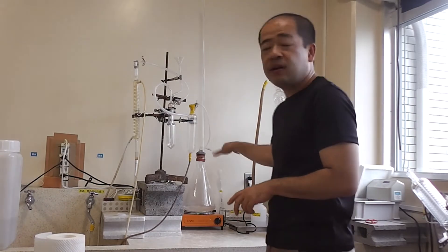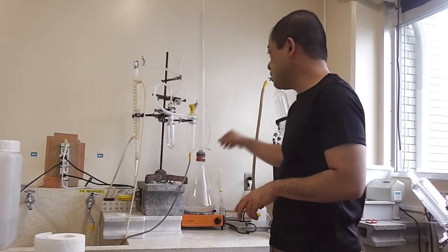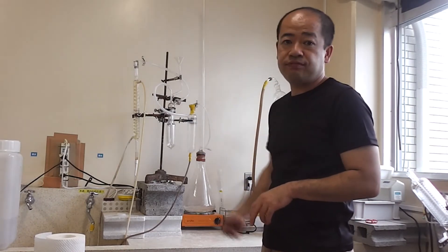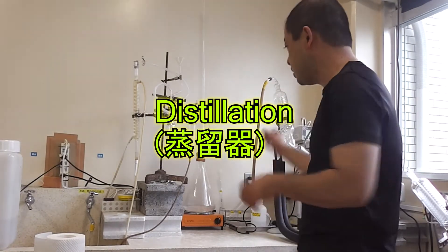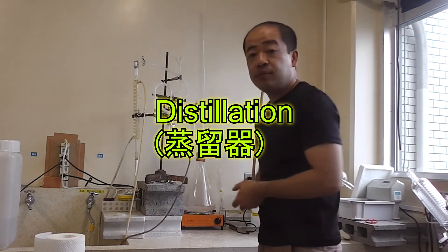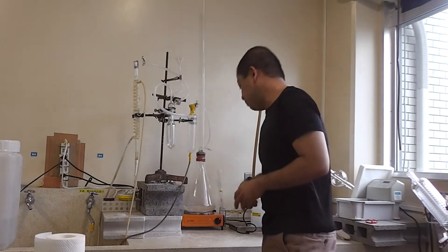But this is a very, very classic one. This is for just distillation. Shortly, I'd like to explain what kind of apparatus this is.